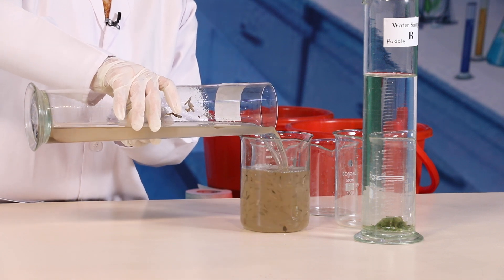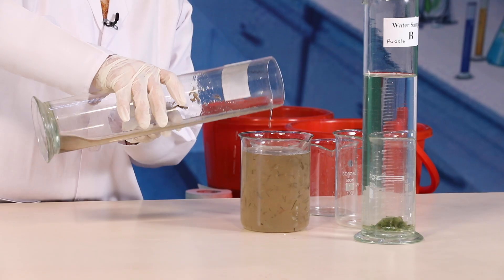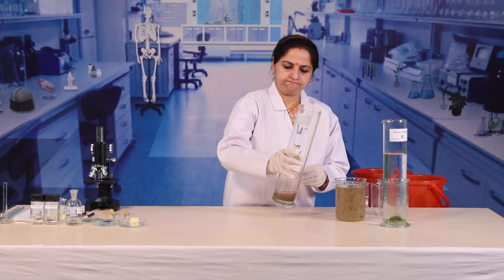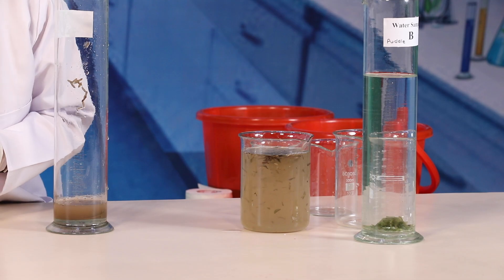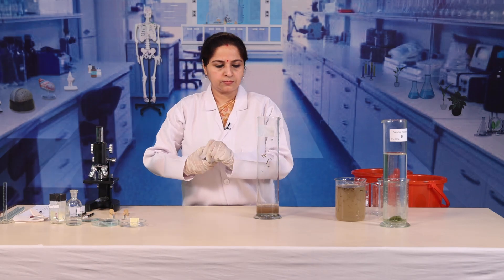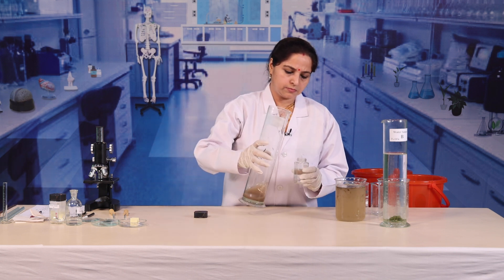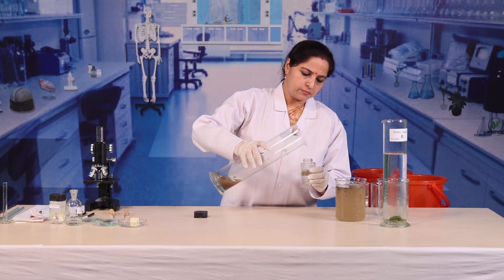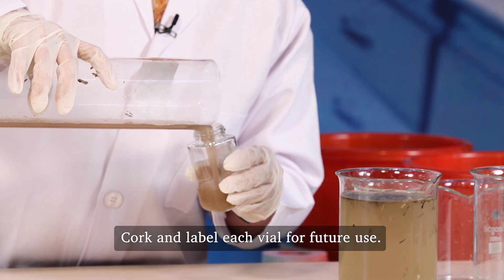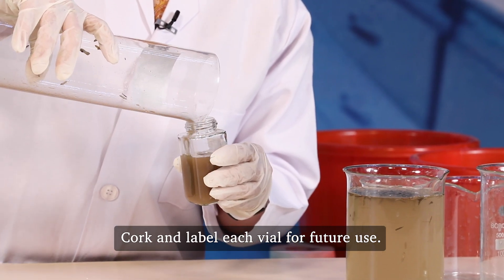Transfer the sediment to a vial or a small test tube. Cork and label each vial for future use.